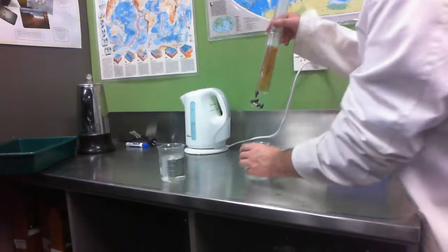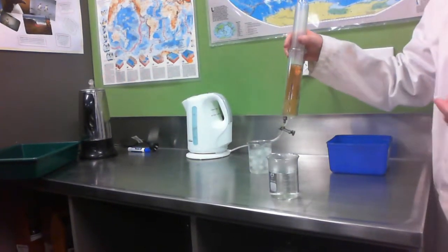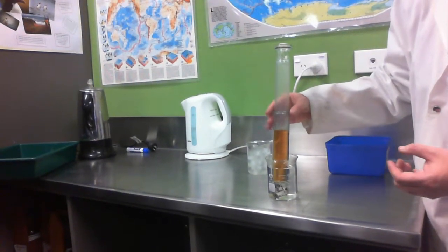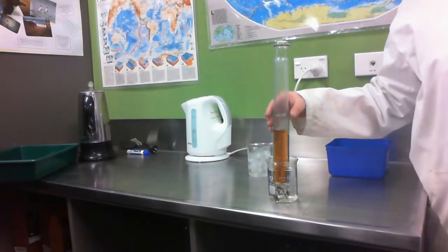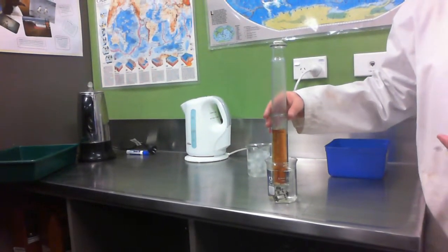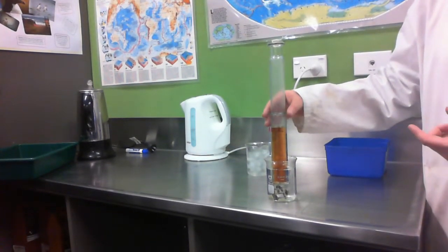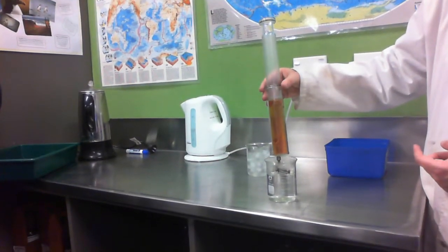So conversely, what would I expect to happen when I put it into hot water? It'll get darker because it'll favour the reverse reaction. Let's see. Now, from memory, this is a little bit more dramatic to see as well. It pushes my syringe away as well because, of course, the reverse reaction has more gas particles in it. That, combined with the increased kinetic energy of the particles, is why our syringe is being pushed away, and it is considerably darker than it was, isn't it?